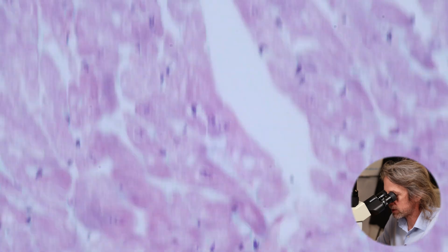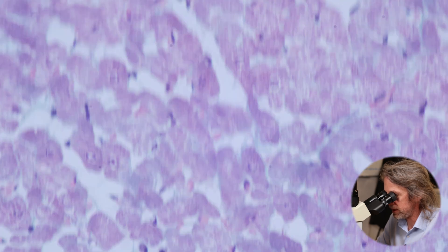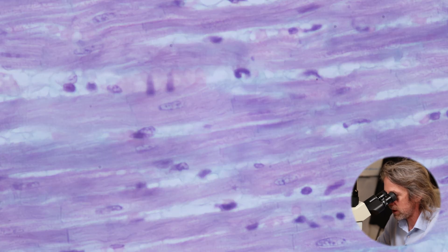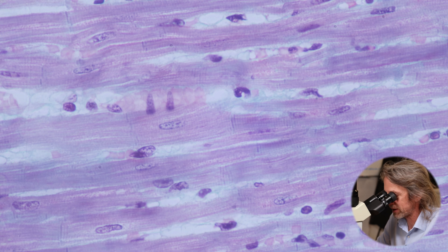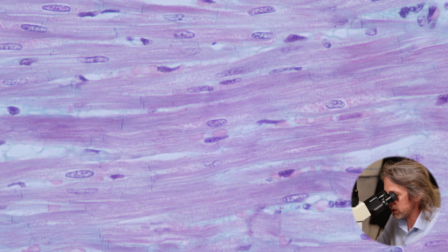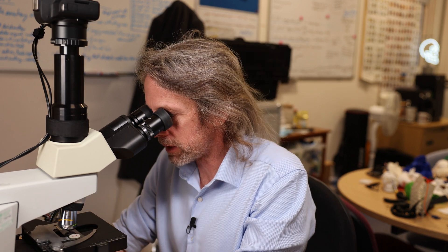Heart muscle has a fairly unique problem: it needs to start contracting in an organized, rhythmic fashion and never stop, so it has interesting energy, oxygen, and metabolic waste demands. The key features are: it's a striated muscle, we have short individual cells with nuclei inside, intercalated discs tie them together and send the action potential to the next cell to trigger contraction, and we have bridges linking the lanes together. Pretty cool as usual — cardiac muscle.